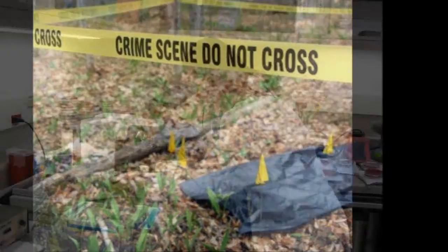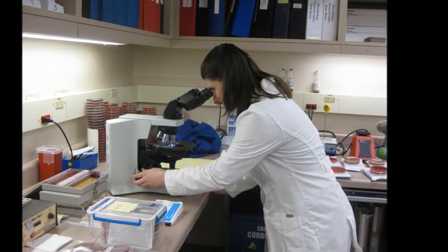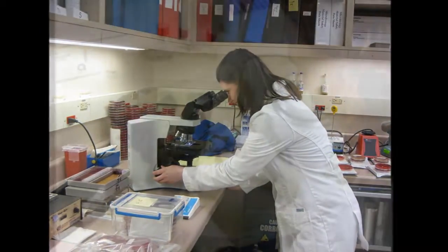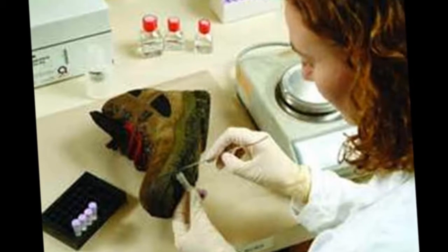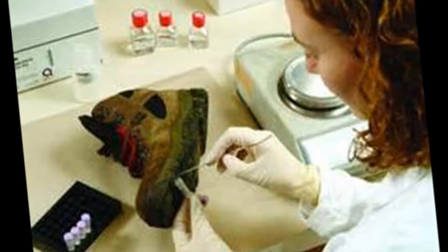These basic procedures for bacterial and fungus samples are used regularly within clinical laboratories, but right now are rarely used by forensic scientists. With the evolving disciplines of microbial forensics and forensic mycology, these procedures may become more common within the forensic science community as preliminary tests.